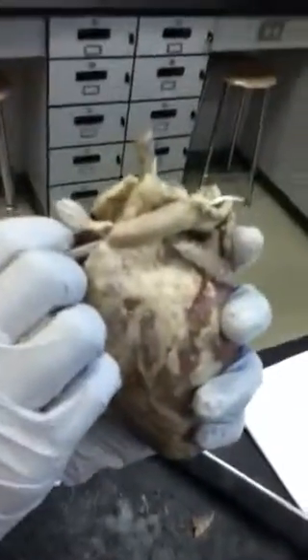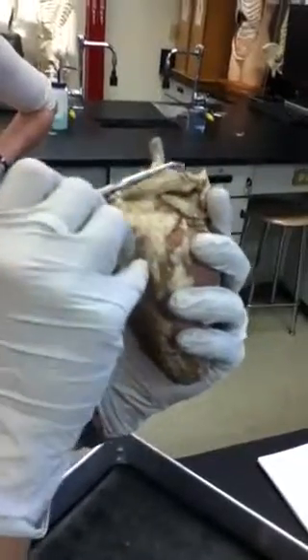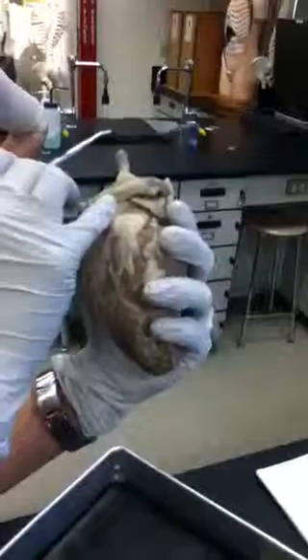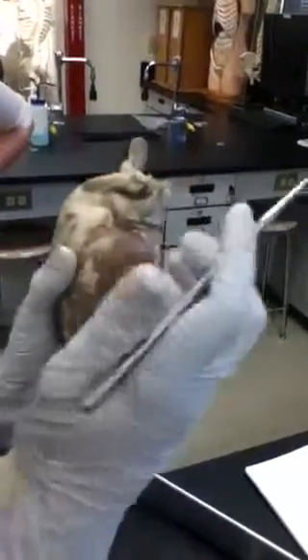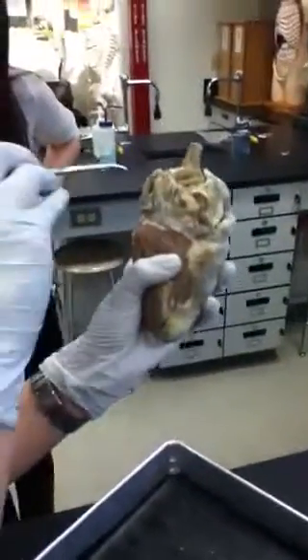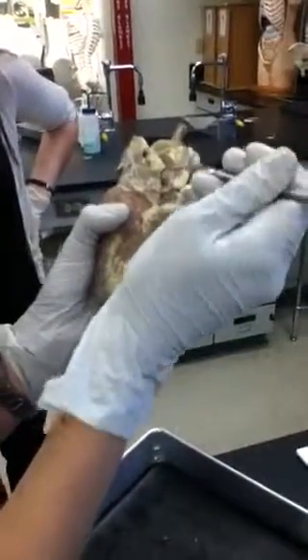And this is going out to the lungs, so this is part of your pulmonary circuit. The pulmonary trunk will branch into the left pulmonary artery and the right pulmonary artery, going to each of the corresponding lungs. When it comes back to the heart, now it's going to be oxygenated. It's going to have collected oxygen, and it's going to come back via the pulmonary veins. You would normally have 2 pulmonary veins on the left, 2 pulmonary veins on the right, and they feed into the left atrium.